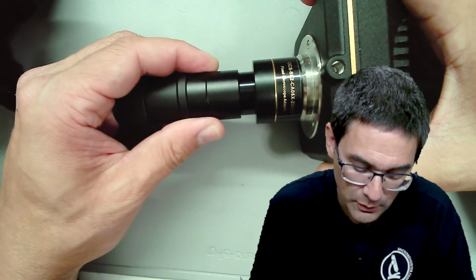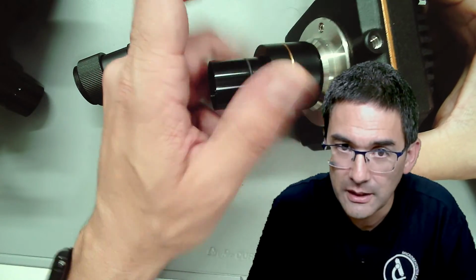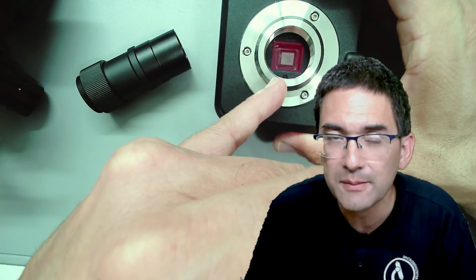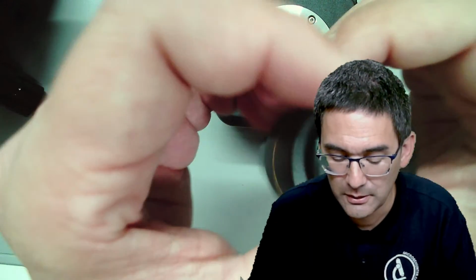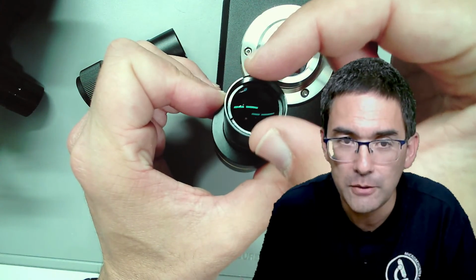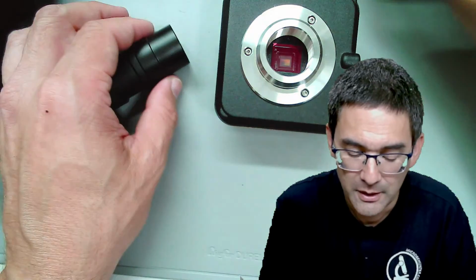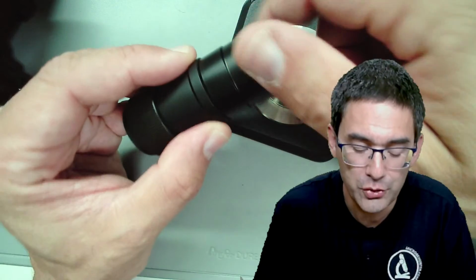And look, what I'm going to do now is detach the optics. You're able to see now the sensor in here, and you see that the sensor is significantly smaller than the diameter here. That's why you need optics like this, because they will take a lot of image information and bundle it together and make sure that it fits on the sensor to increase the field of view. But there's something that not many people know, because some of those photo tubes have a top that can be removed.